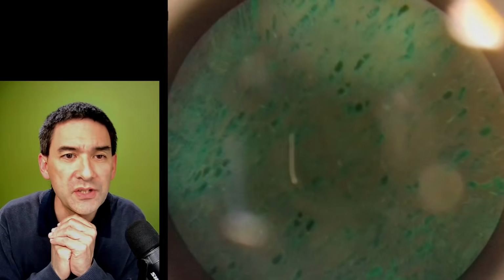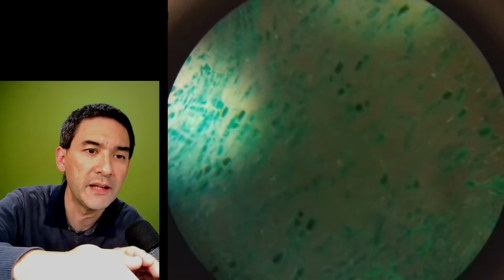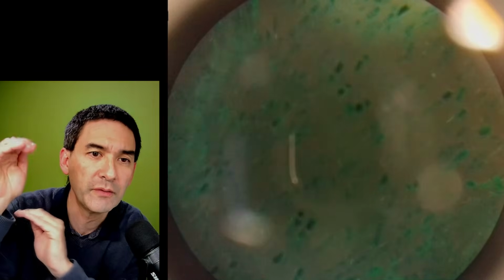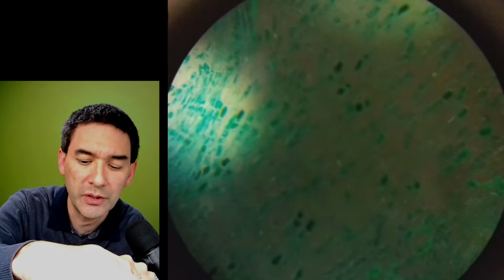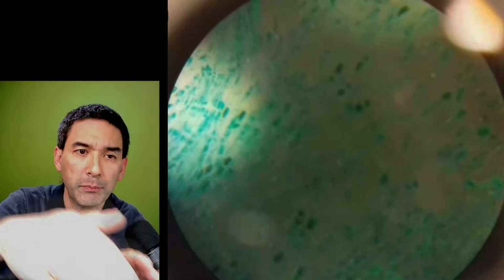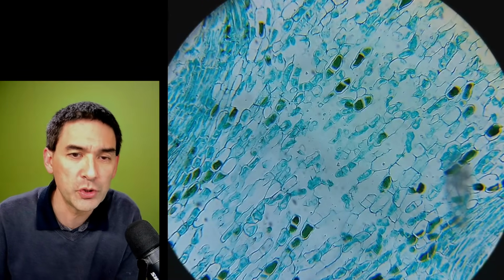So here we go again. And if I switch off the microscope, then you're actually able to see that there are reflections here because of this gap. What I'm going to do is hold my hand over the whole thing, and you can actually see that the reflections become less. So maybe a little bit of cardboard might also do the trick, to block the light. But generally not a big problem because the microscope light is so much brighter anyway.